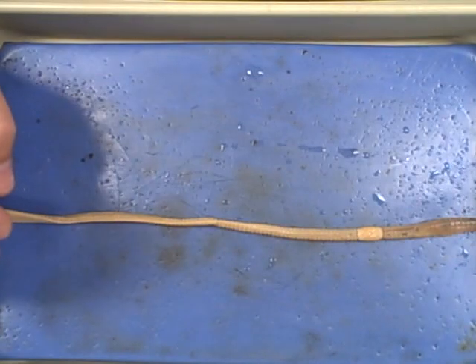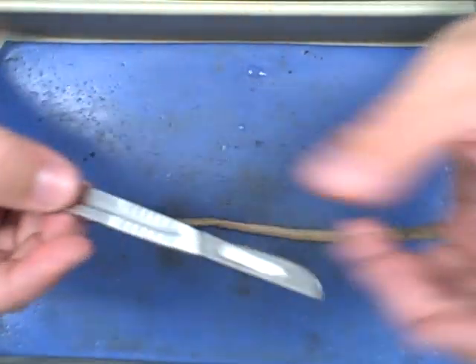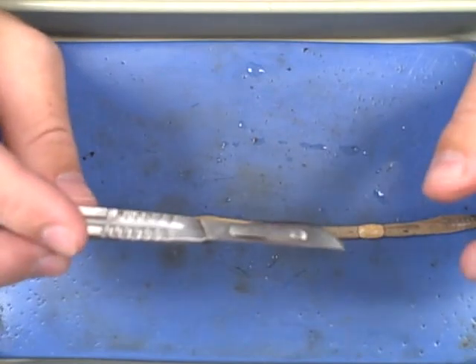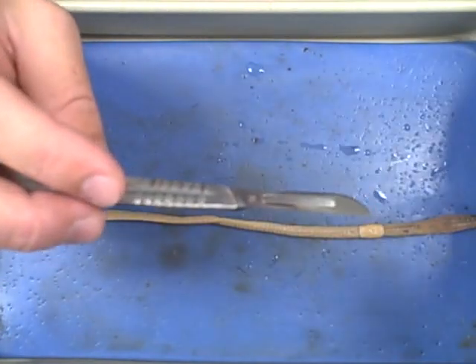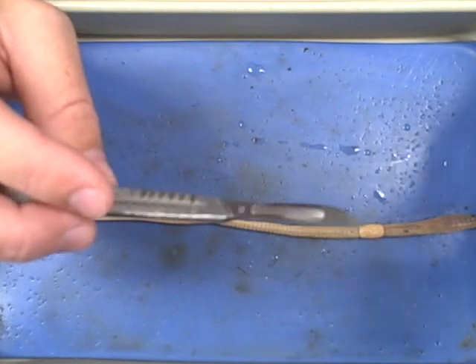Now when you're ready to start the dissection, you need to have a few tools on hand. The first would be the scalpel. Make sure your blade is sharp. If it looks dull, contact the teacher and they will give you a new blade. Do not hold the blade with your fingers close to the blade, because that is dangerous.